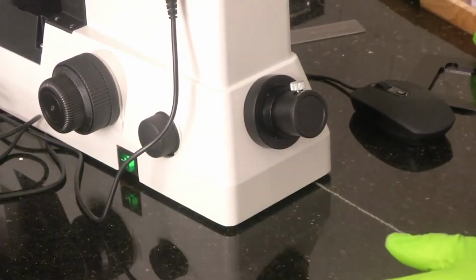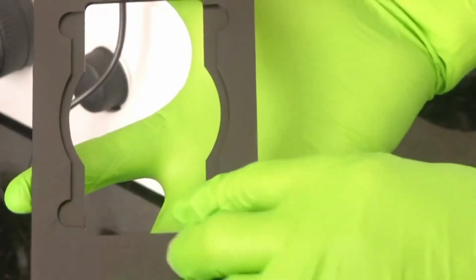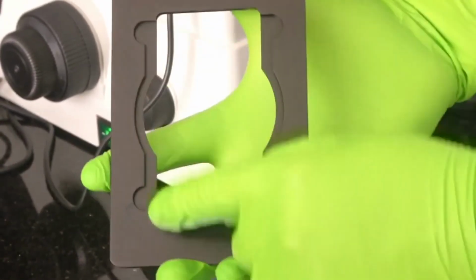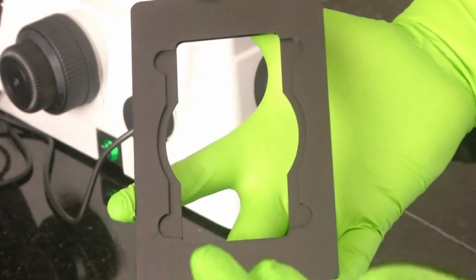So just like this glass slide, there are bigger glass slides. We are not having such glass slides with us right now. If you see, this is another sample holder. This has this much size glass slide. So you can put that glass slide here. Big glass slides, if you want to examine, you can put it here. It will get locked and it will sit here.